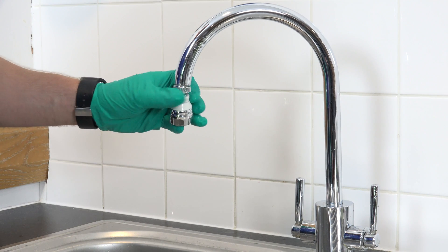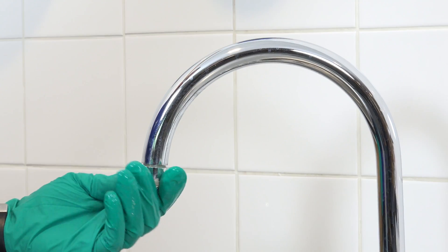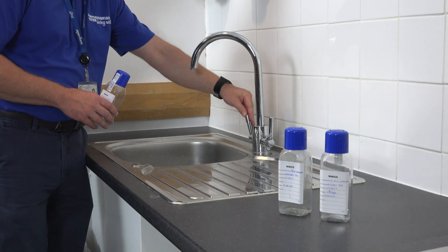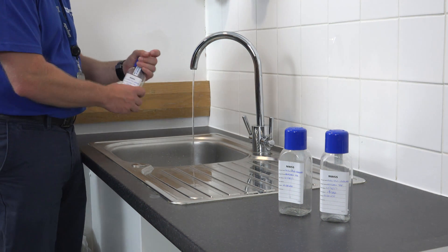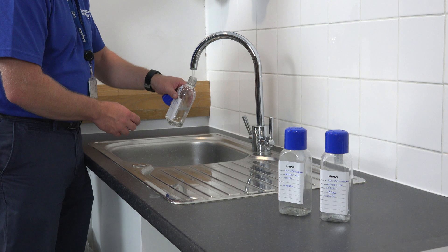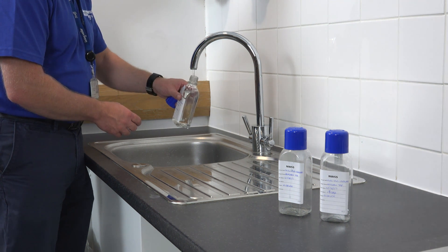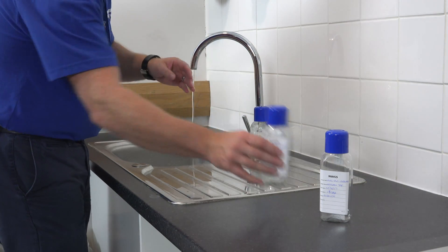Having followed the advice in video number 4 on selecting suitable sampling taps, you will already have removed any tap attachments and any removable tap inserts. Once you're ready to sample, turn on the tap and adjust the flow of water to a steady, gentle flow. Holding the bottle by its base, remove the top and hold it in an upright position with its opening facing downwards. Fill the bottle to approximately 1cm below the base of the neck, ensuring that a suitable air gap remains, then carefully replace the cap.